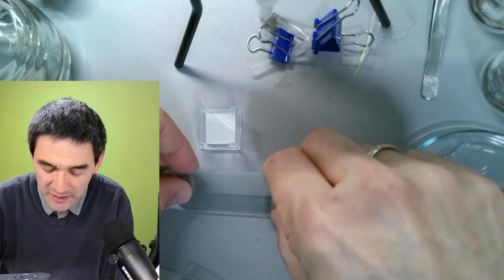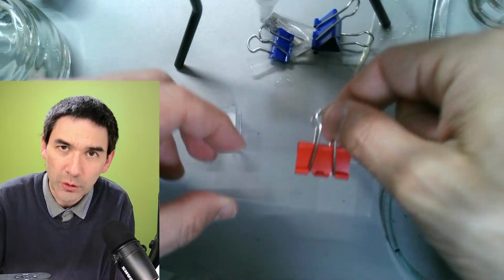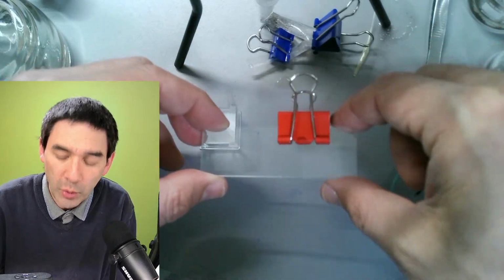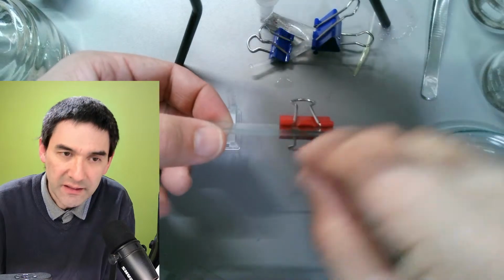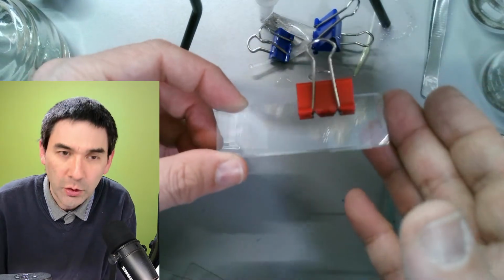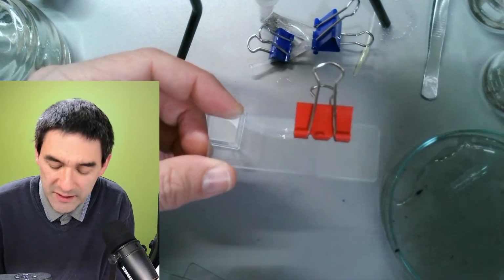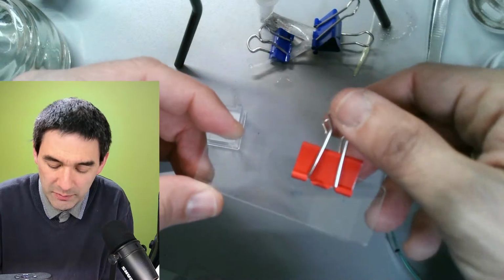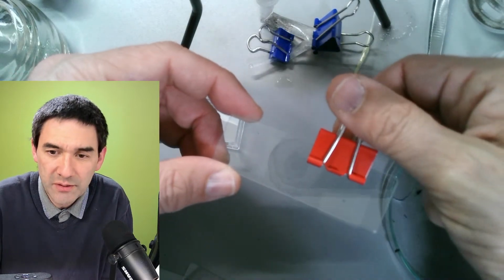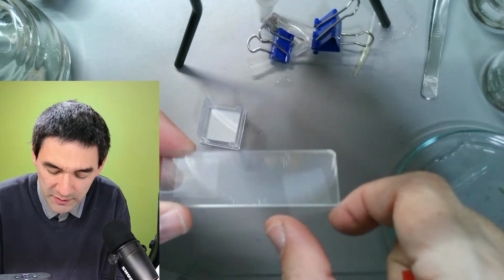You clamp it together like this. Okay, you clamp it together and then you submerge the whole thing in alcohol to remove the water. Then the insect is really squeezed flat, and you put it into alcohol for several hours, and then basically you can make a permanent slide. So these are some ways of how this can be used. I consider them to be quite useful.